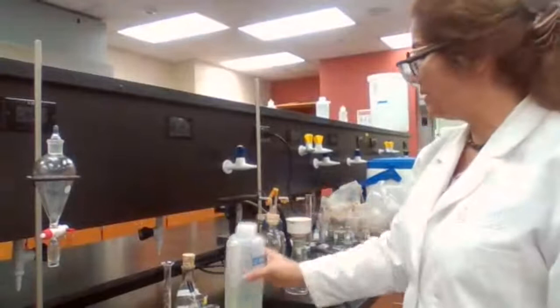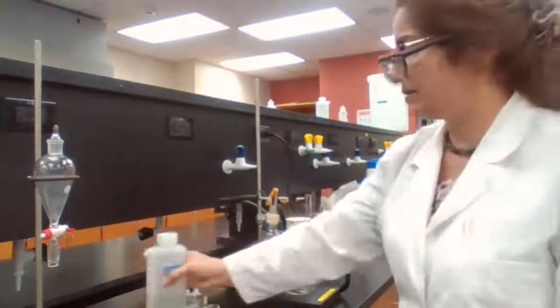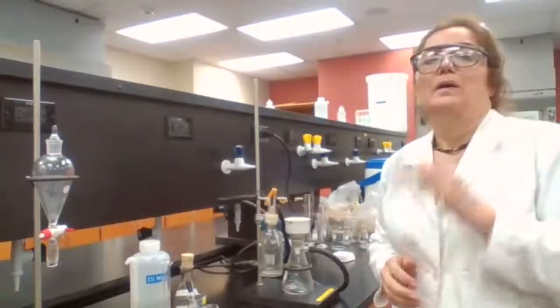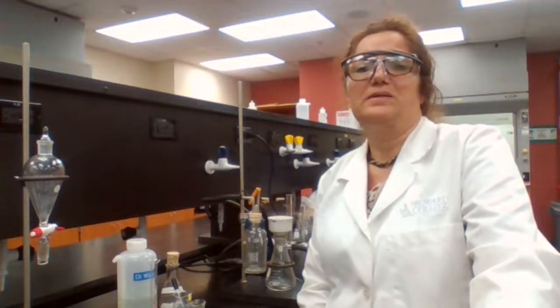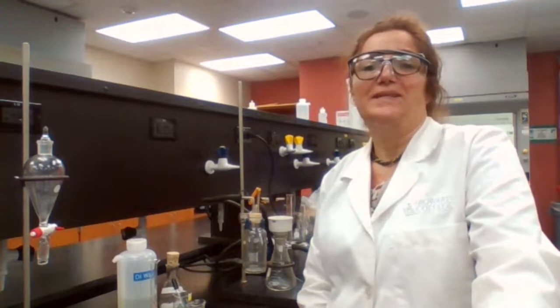I place it in the funnel, add a couple drops of water to make sure that it's going to stay still. And now, you told me to place an ice bath at 10:54. Now it's 10:59. So it is exactly 5 minutes.